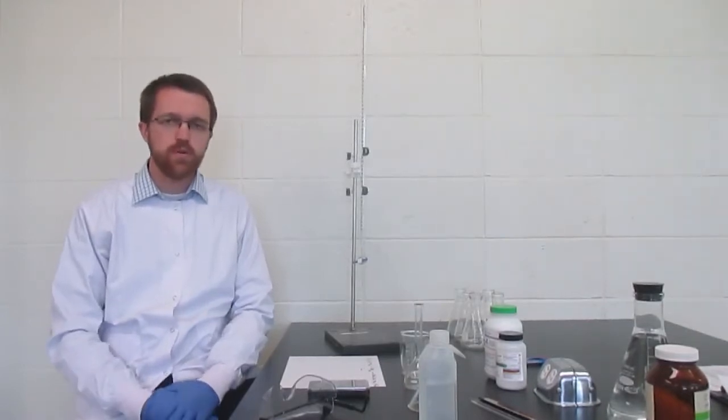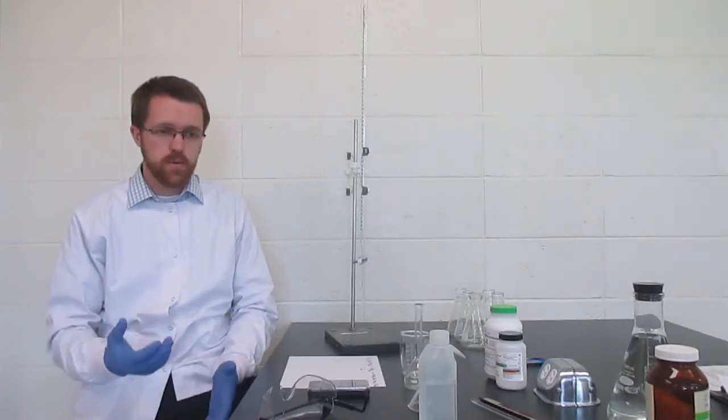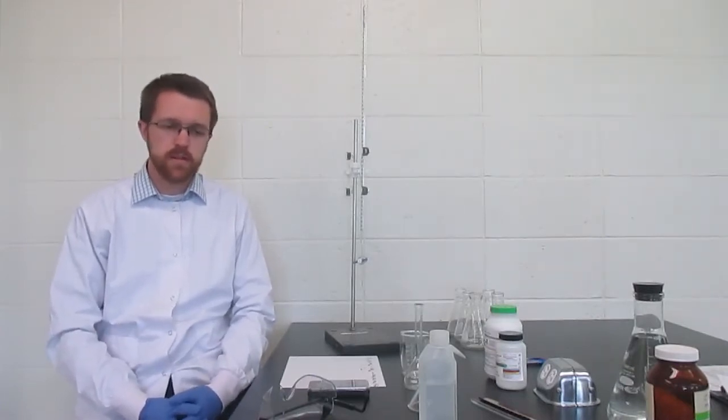This video will demonstrate how a titration is performed and go through some of the basic procedures and things to watch out for for students performing labs like this.